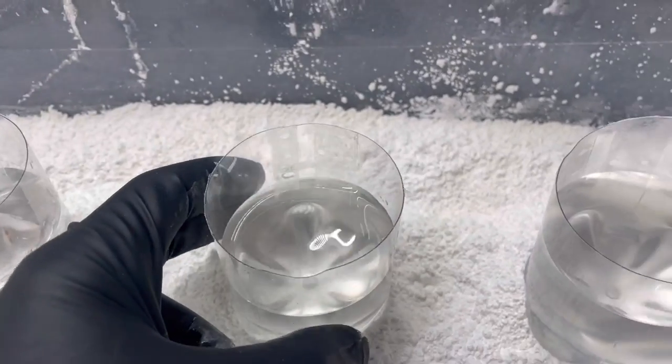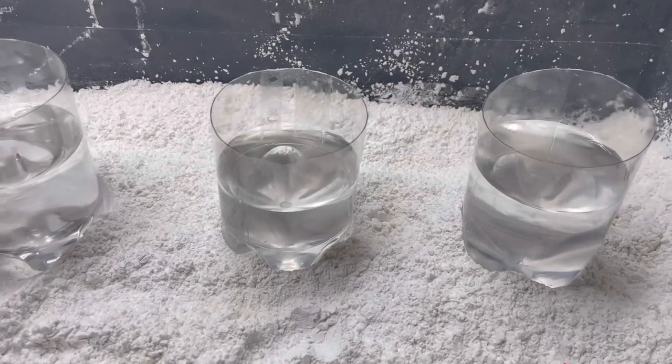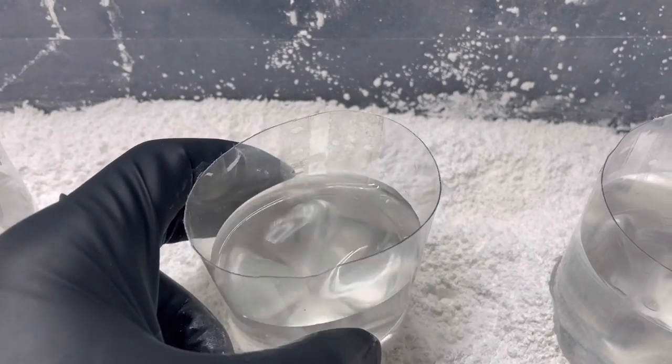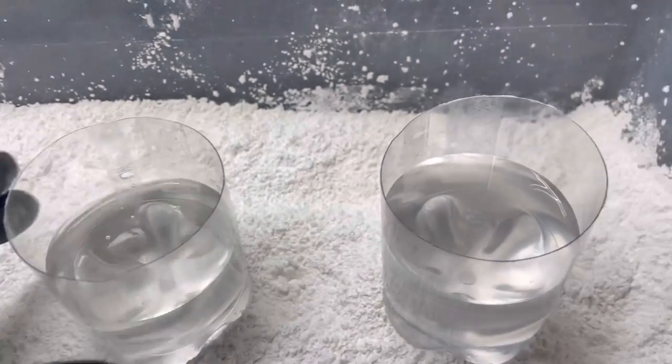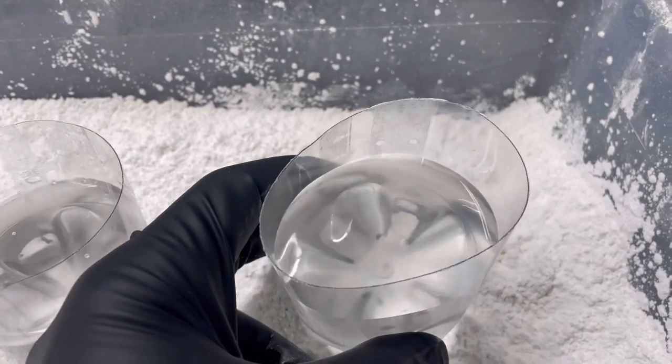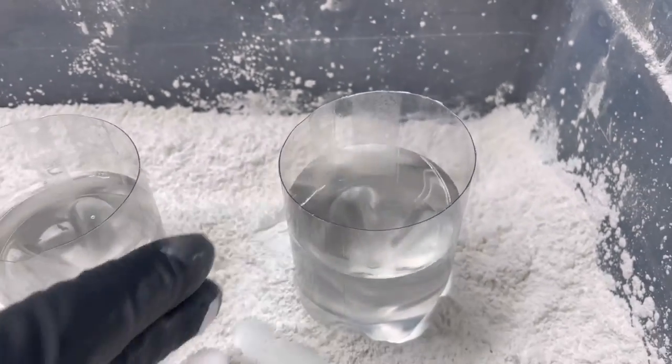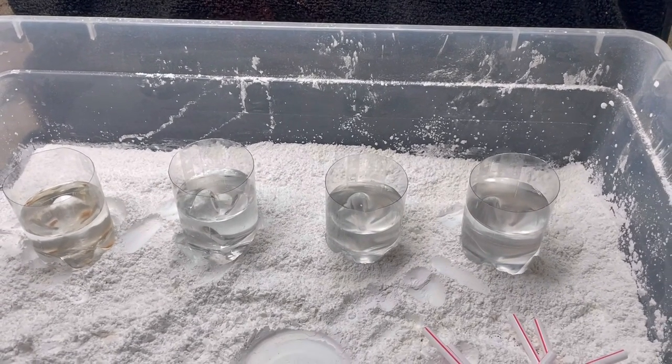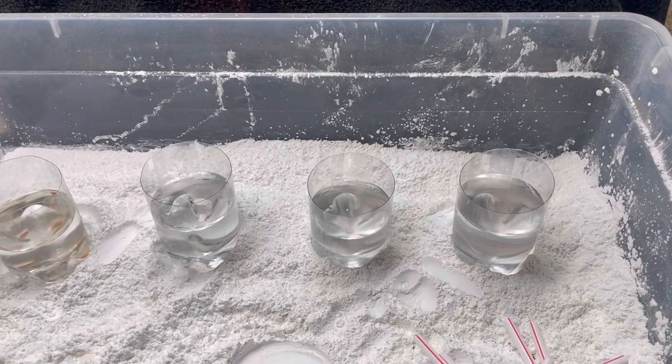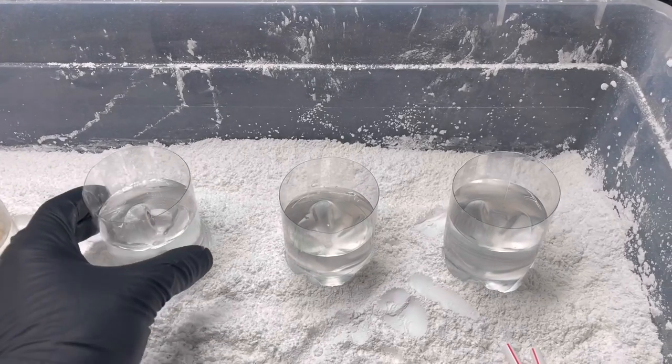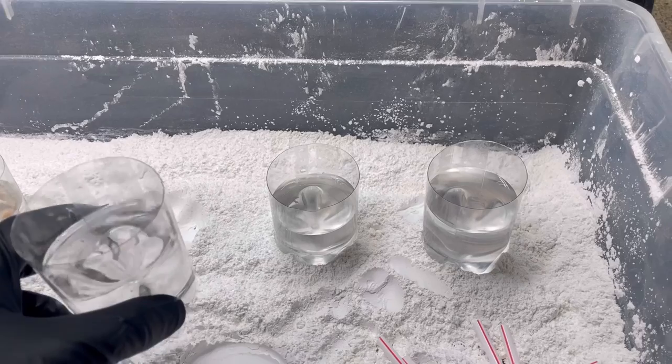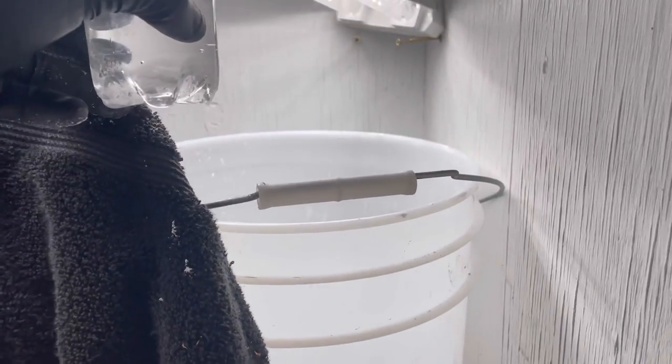And these two you can see the solutions are a little bit dark, maybe even greenish greenish gray. There's not much in the way of sediment but the solutions are kind of cloudy. I don't know how that shows up on the camera, there it is. I'll just dispose of this acid. What I'm going to do is just react with lime water, make calcium fluoride which maybe I'll use as a flux later. In fact I've got a bucket right here just for that.